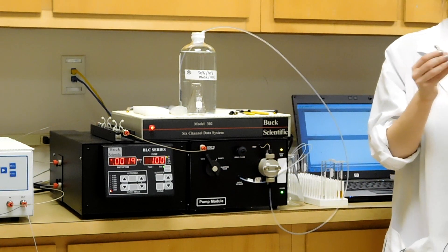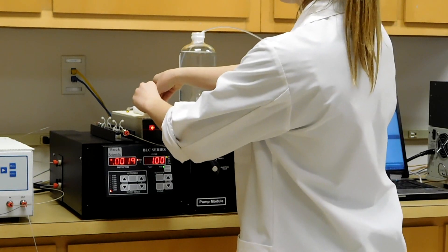Next, it's important to separate it, and put it aside so you can clean it later. So next, we're going to run it through the system.